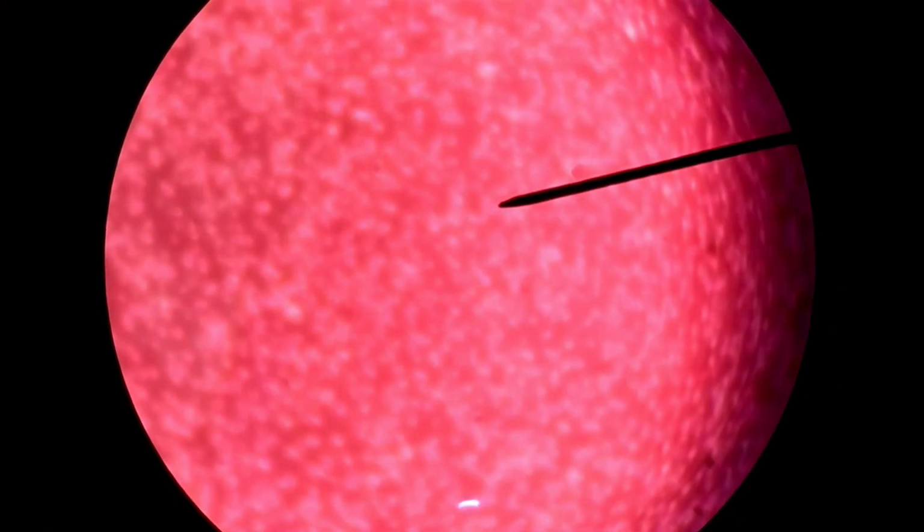So what I'm doing is putting just a little bit of oil. I know you can't see anything right now, guys, but I'm putting a little bit of oil, and I'm going to carefully switch to the oil lens magnification and do a little fine focusing, and there we are. You can see all the tiny little bacterial cells. This is a slide that was labeled Klebsiella pneumoniae, and you can see that all the little clear spots are where the bacteria have capsules around them.